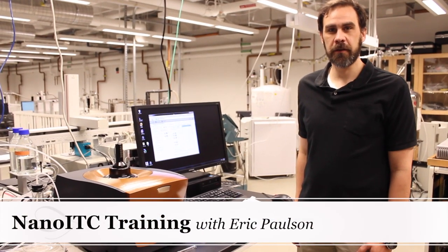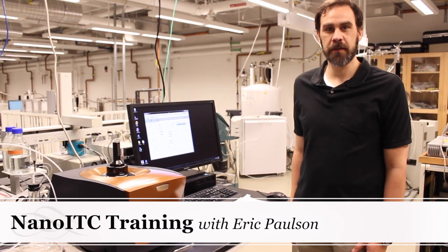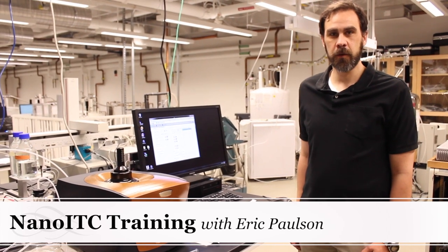Hi, I'm Eric Paulson, director of the Yale Chemical and Biophysical Instrumentation Center, and today I'm going to show you how to use our isothermal titration calorimeter, or ITC.